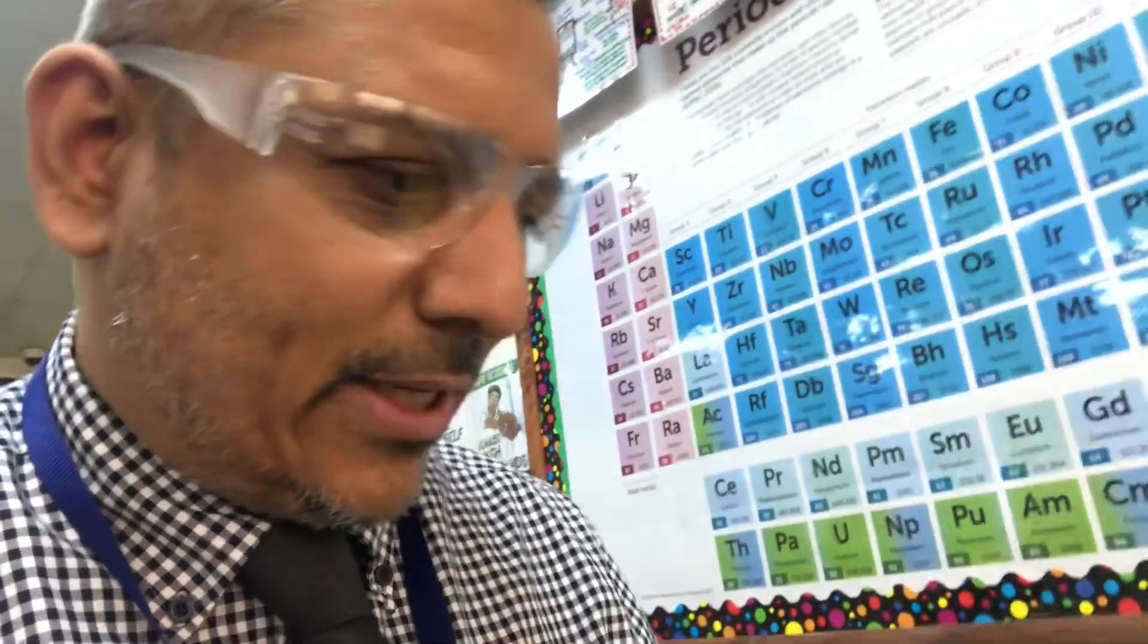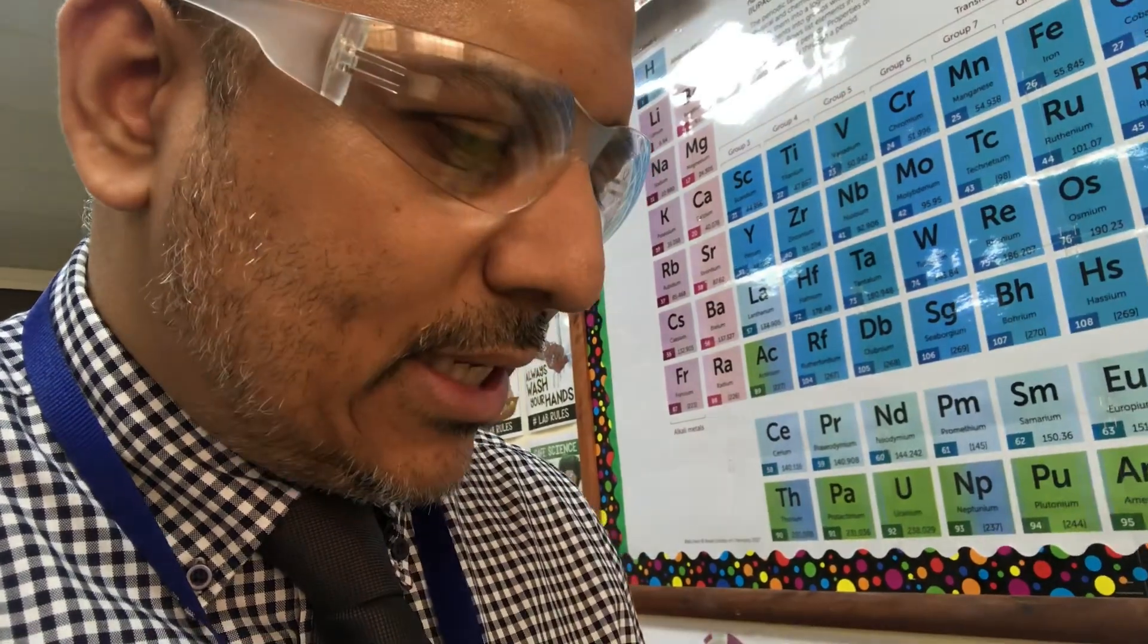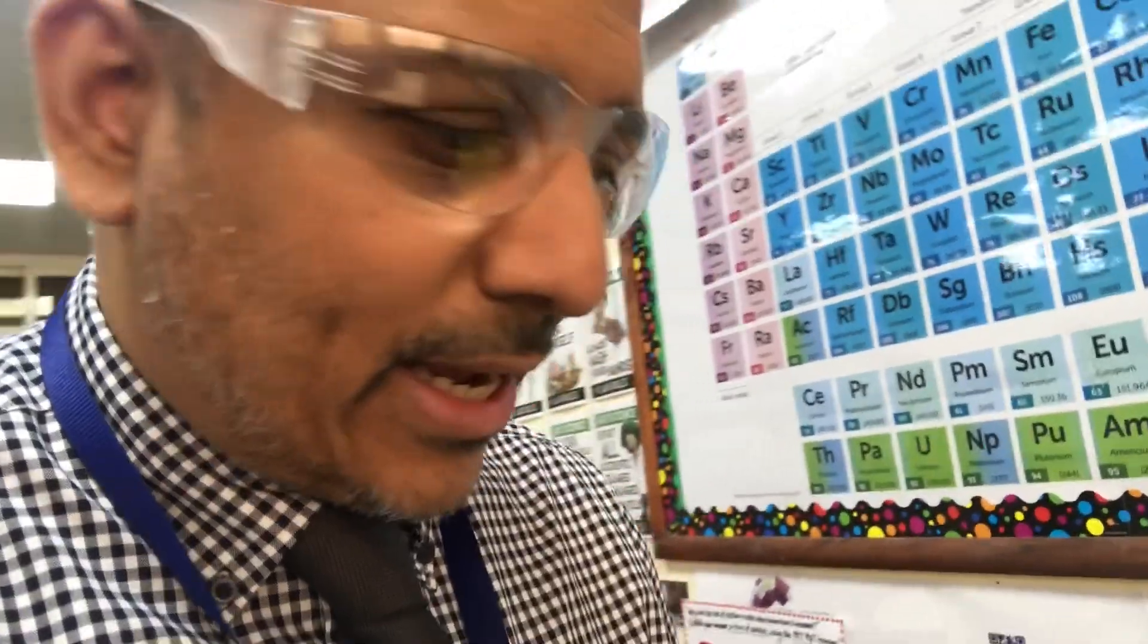And what I'm going to do is I'm going to be placing them together in a boiling tube. I'm going to show you how you can keep everything in because by experience I find that quite a few bits of it escape when you're heating it. And then we're going to have a look at the product. So let's take a look at how you set everything up for your class.